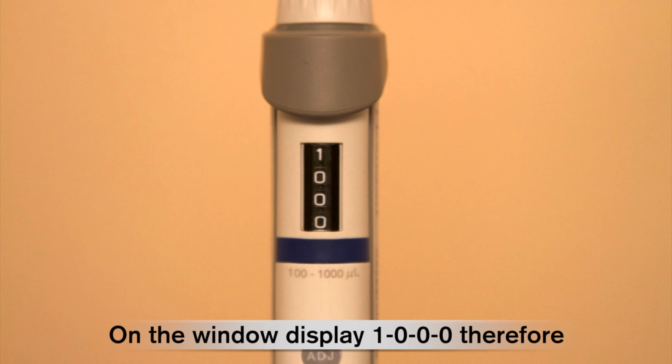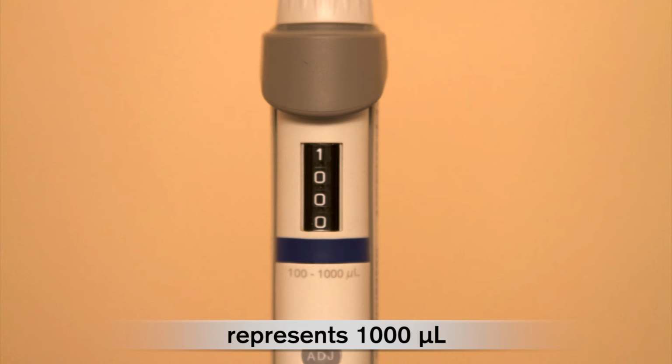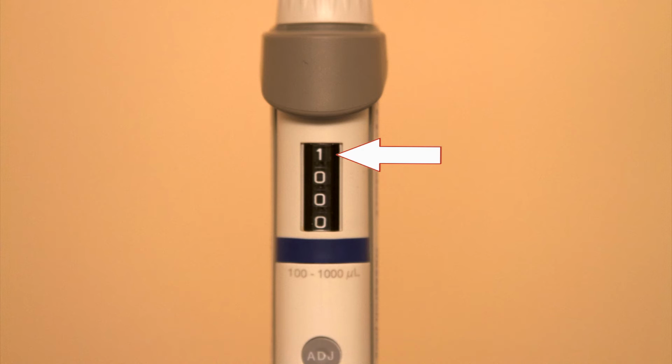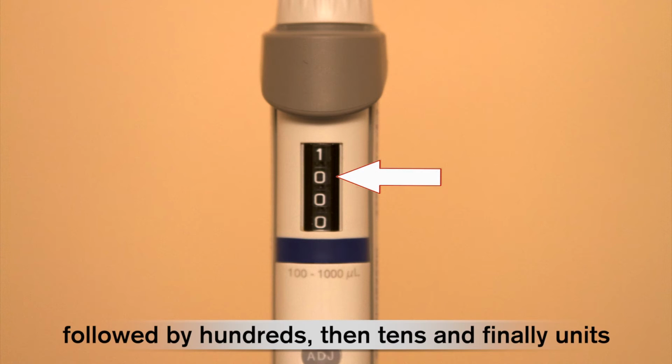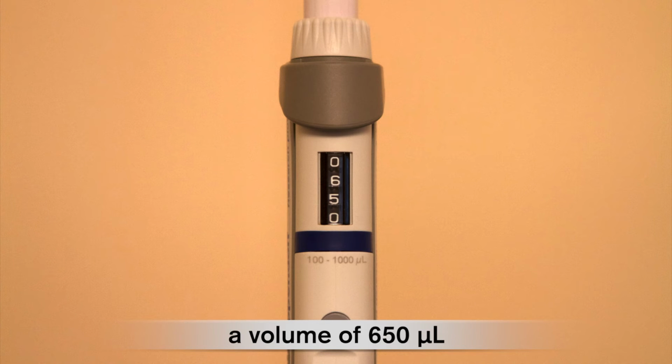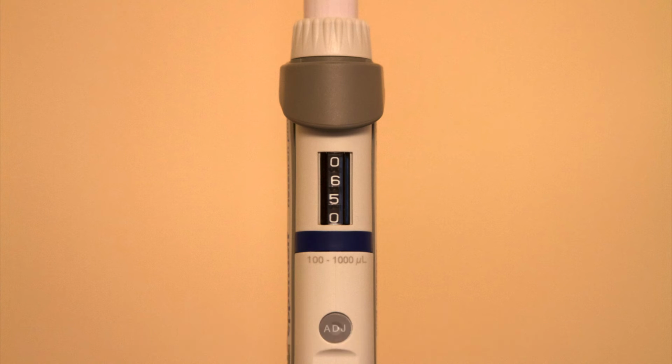On the window display, 1000 therefore represents 1000 microlitres. Again, the upper number is thousands, followed by hundreds, then tens, and finally units. Therefore, this pipette could be used to set a volume of 650 microlitres.